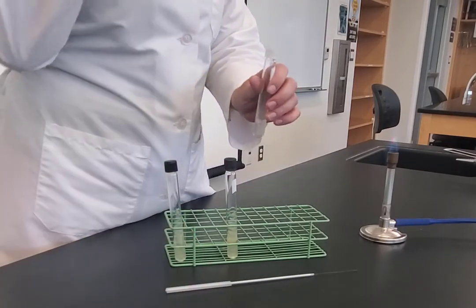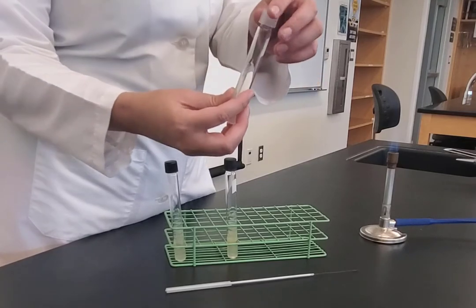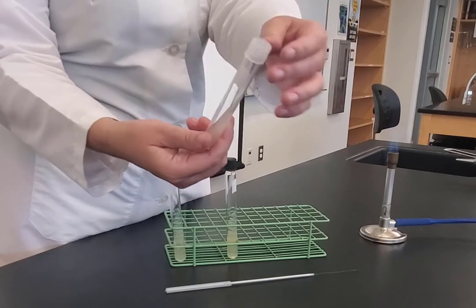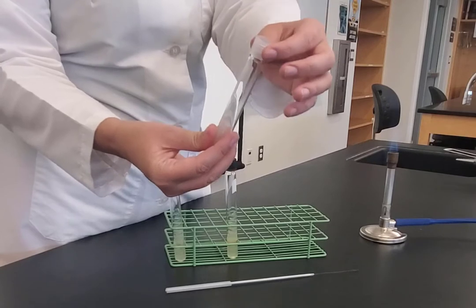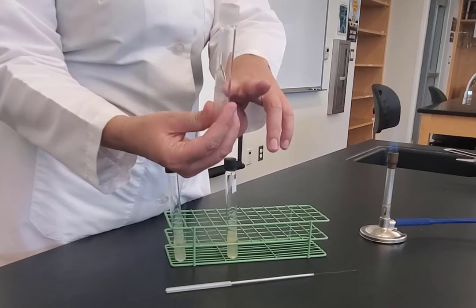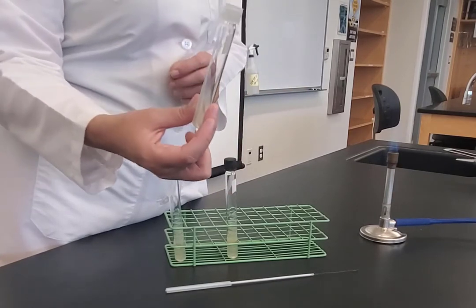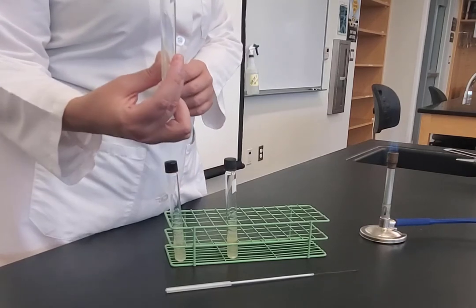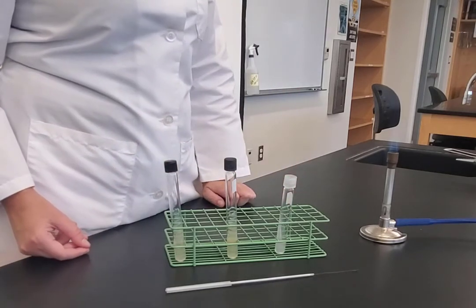I would repeat this with the other organism as well. With these screw-top tubes, tighten the cap all the way and then give it about a half turn to loosen it — it should wiggle but not fall off. Do that for both tubes, then put them in the incubator. After 48 hours, add the reagent to test for phenylalanine deamination. This is how we set up our phenylalanine deaminase test.